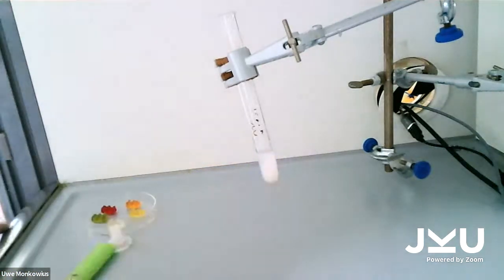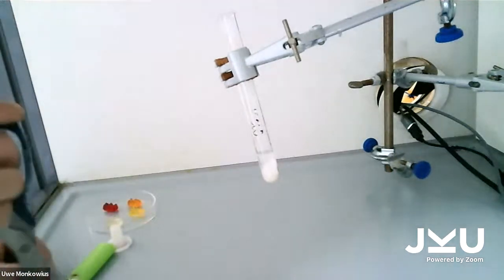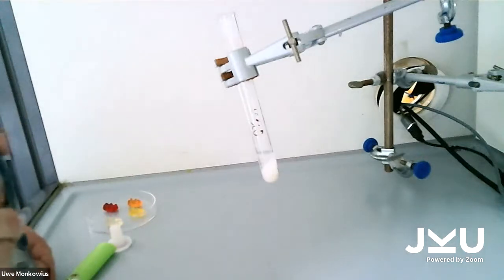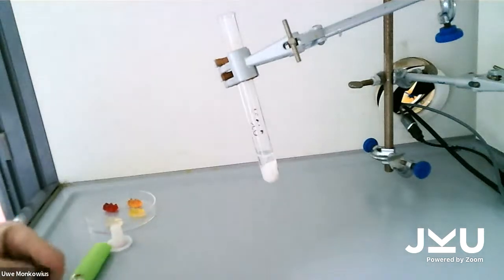Yes. So now, is there any input from the audience? Take the green one. So nobody online wanted anything, so I just take the green one, and I'll cut it in half so it doesn't get stuck in the test tube, and then I'll add it. Too dumb to cut with a scissor apparently. Oh, this gummy bear is struggling. Oh no, I got it. So now I'll add it to the test tube and let's see what happens.